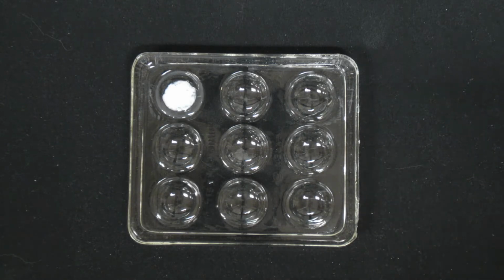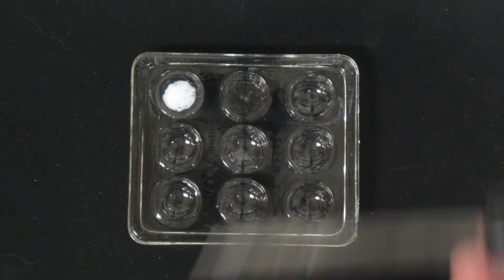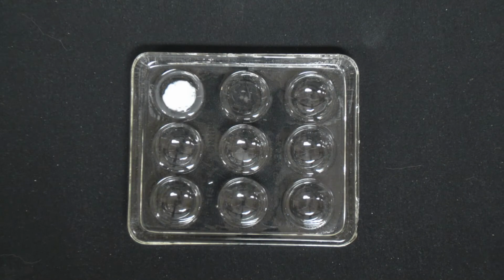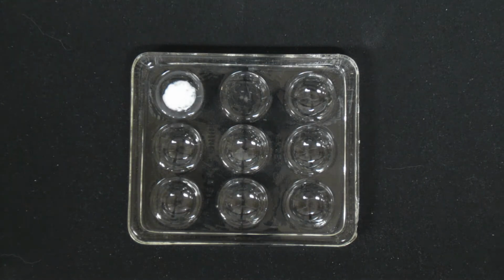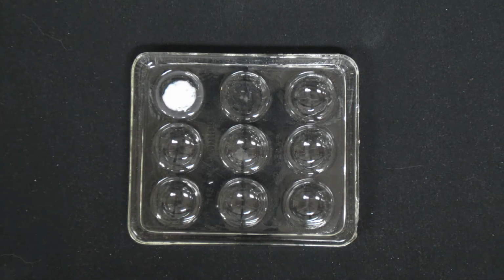And then the second one is going to be silver nitrate again. Silver nitrate is a really common salt that you use. Silver forms a reasonable number of insoluble salts, but silver nitrate is completely soluble. Matter of fact, pretty much all nitrate salts are soluble, so you'll see it's a really common anion in these kind of reactants for precipitation reactions.